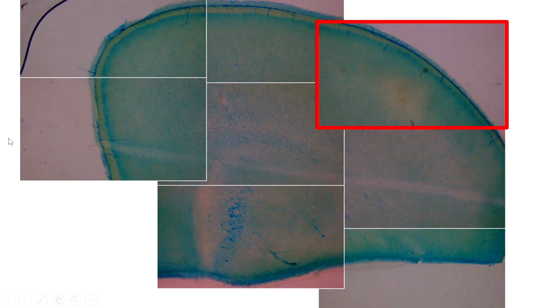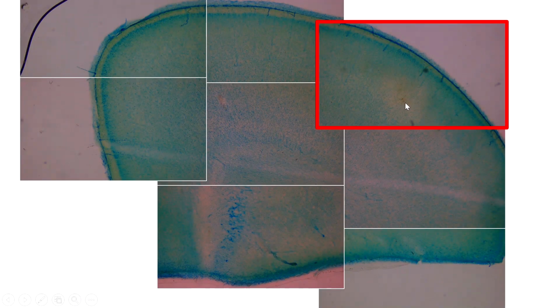Okay, so this is the image of this biocytin-filled pyramidal cell. So this is the whole brain slice. And then your target is very small. It is this little guy here. I'm going to blow it up. See, this is the one. Somebody used a very fine needle to inject biocytin into this neuron. So that's really fine work to do. And did you see how small it is? So when you're looking for this cell, you've got to use the 4x objective lens. Otherwise, you are going to search a lot of miles to find this little guy here.